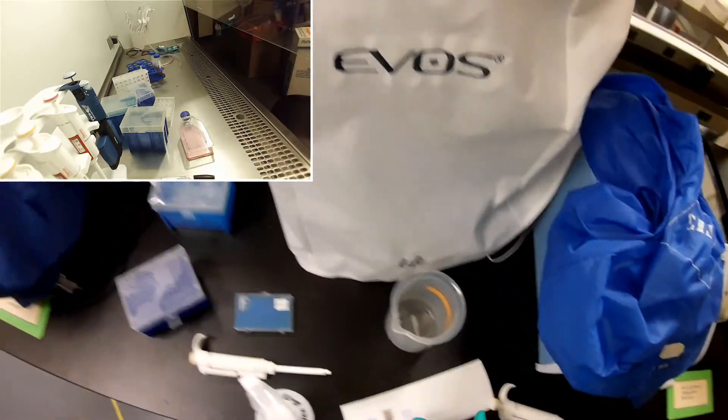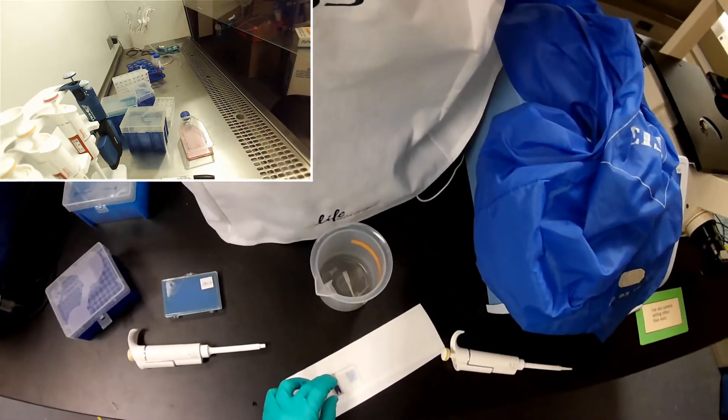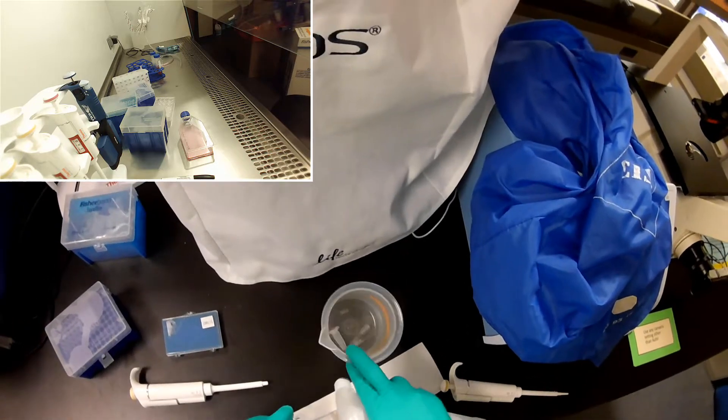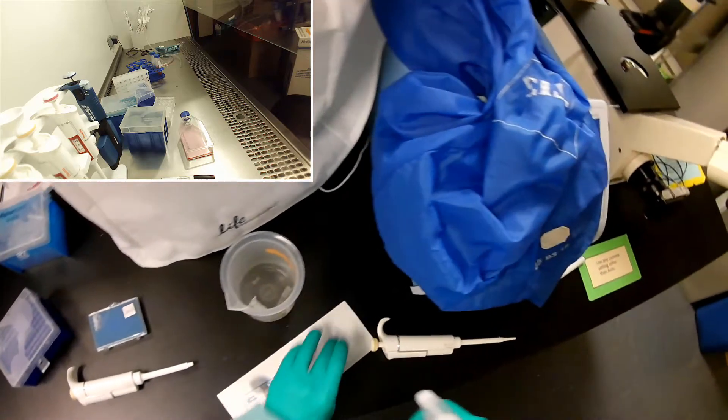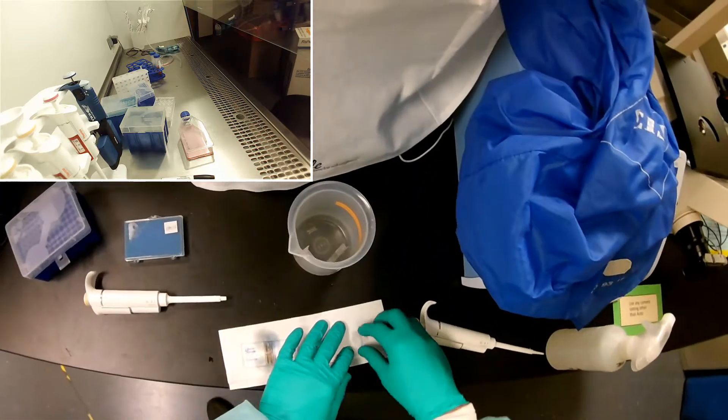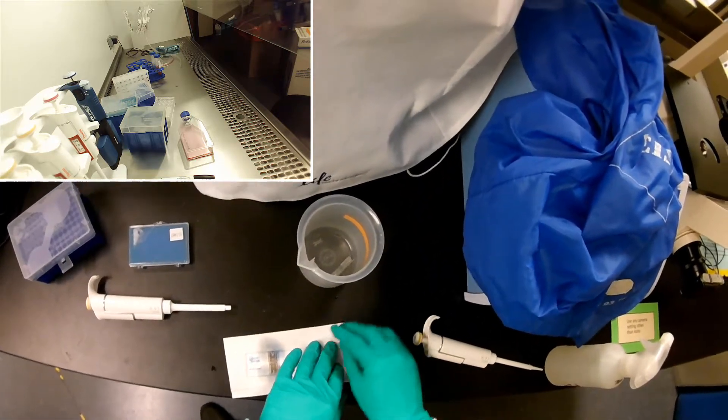Now that I have a successful count, it's important to make sure you clean this stuff up. I'm going to make sure all my trash is in the tip waste. I'm going to clean off the slide and the coverslip with ethanol.